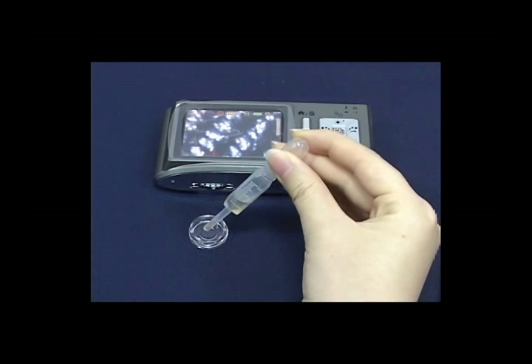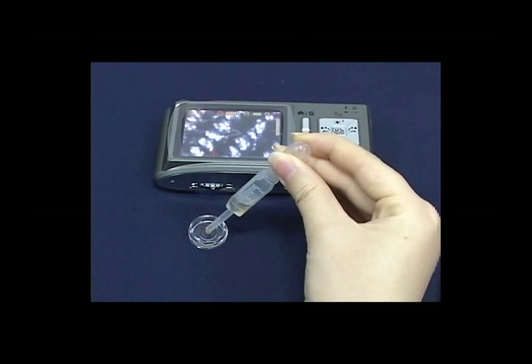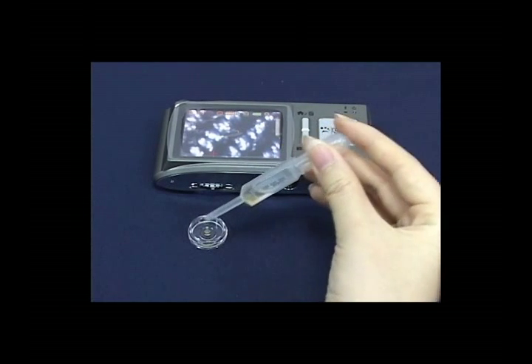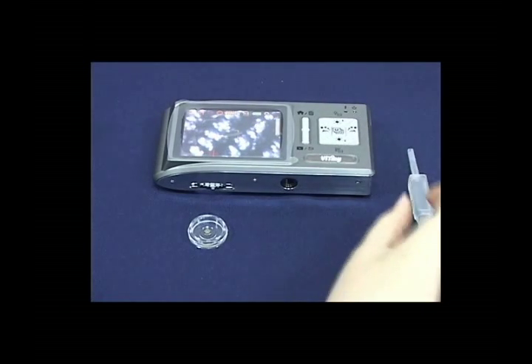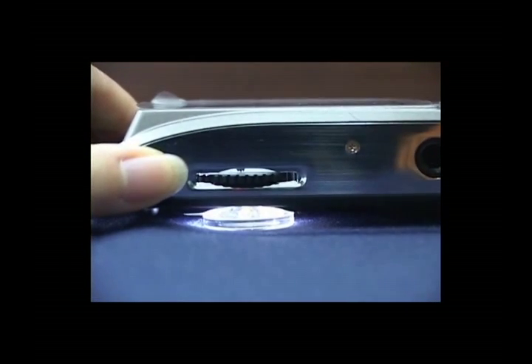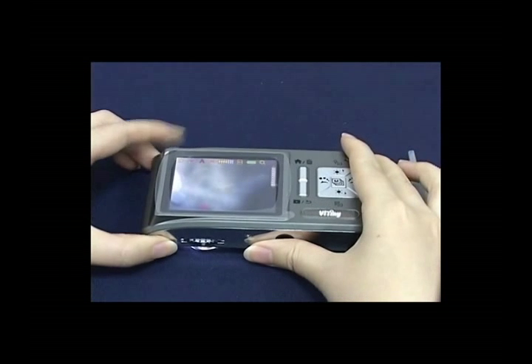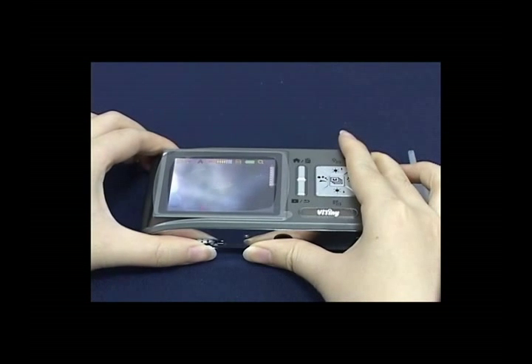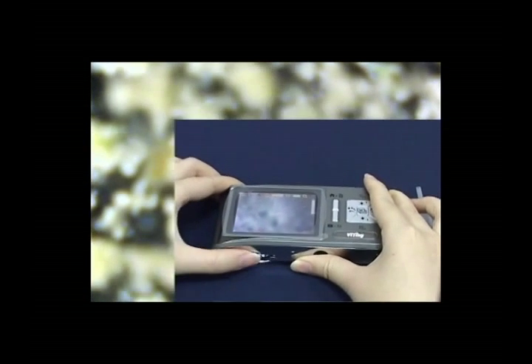When observing objects, place them into the shallow tank, which you place above the machine. Shallow tank is used to observe drops, sand, fish eggs, spores, diamonds, etc. Adjust the focus and lighting to start observation.